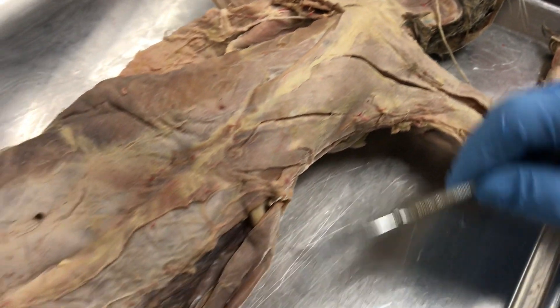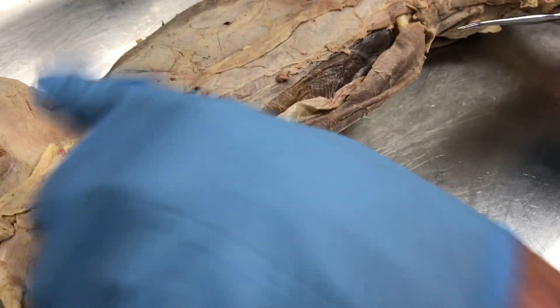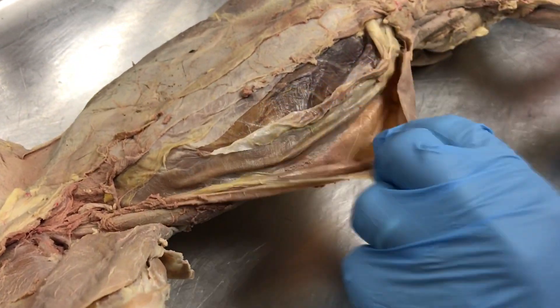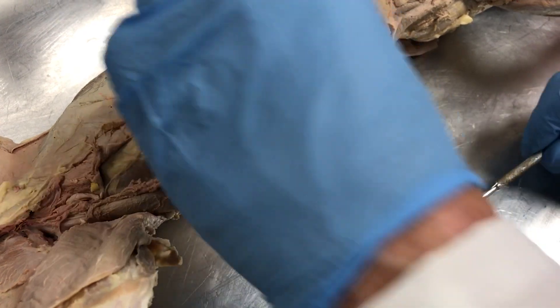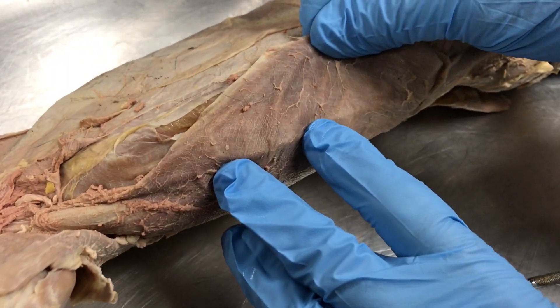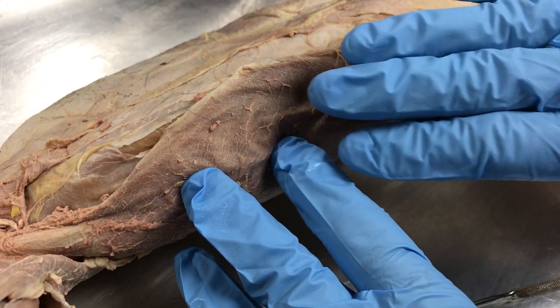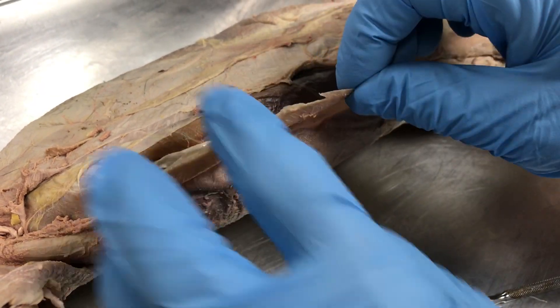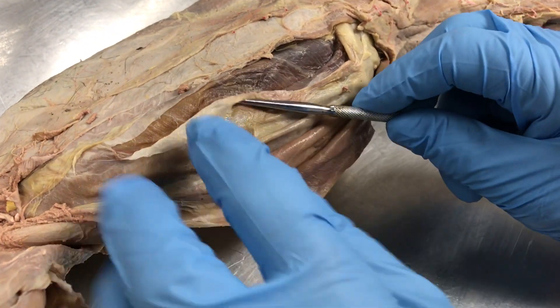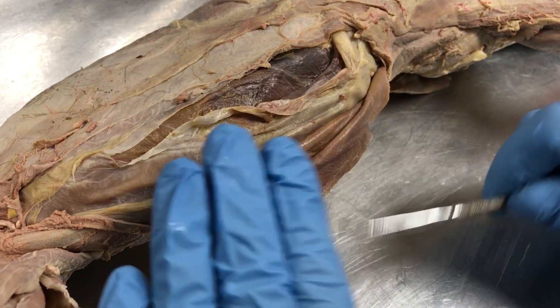Now we're going to go down to the abdominal area and name the muscles here. This is the external oblique. Notice the direction of the fibers — they're actually going in this direction as if they're putting your hands in your pocket. We've dissected that earlier, and then underneath we have the internal oblique right here.